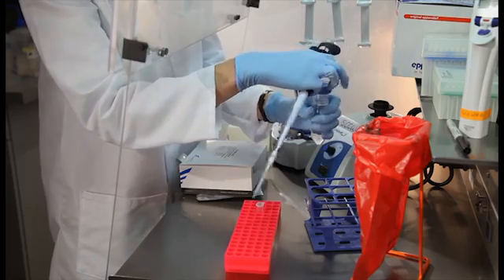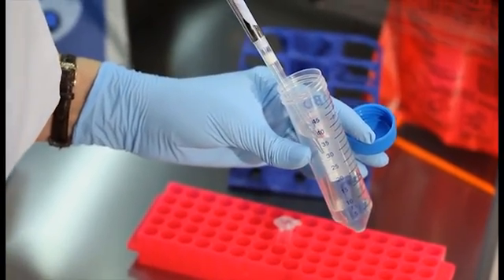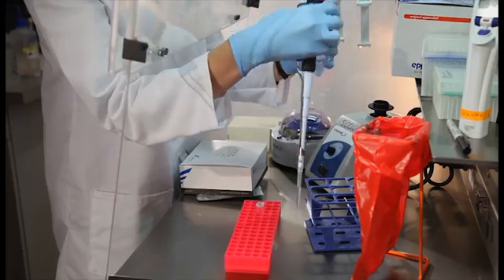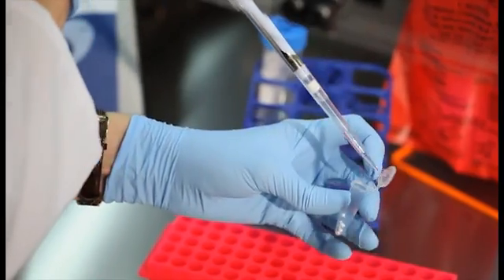Next, add nuclease-free water to the beads: 40 microliters for each Omnimix bead, and 80 microliters for each primer probe bead. This is the specimen processing control mastermix.